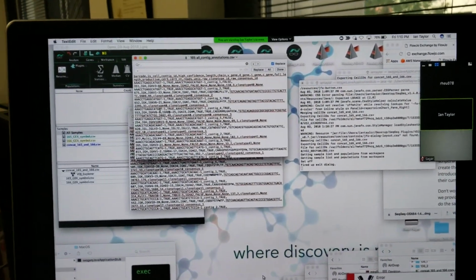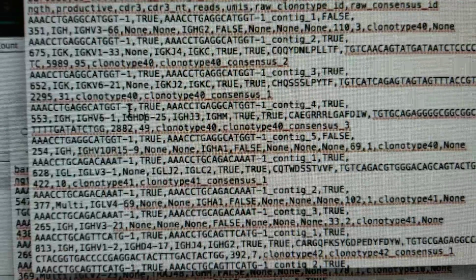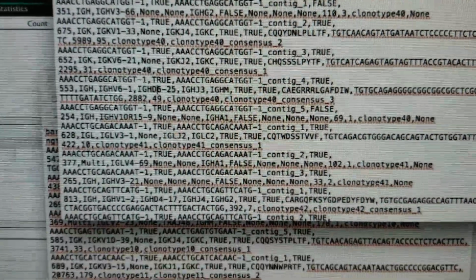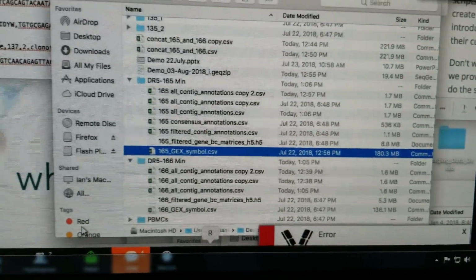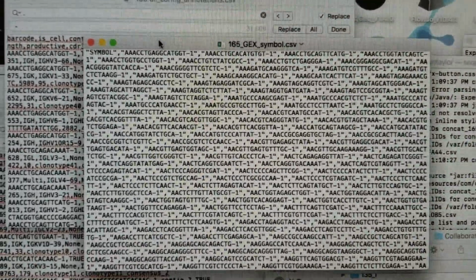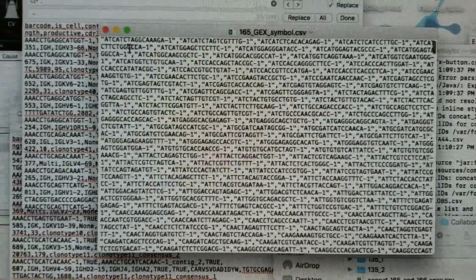We have barcodes which contain this oligo tag along with a -1. I'm not sure why that's added, probably by Cell Ranger, but that means to match the raw data. I can open up one of those gene expression files here, maybe 165, in something like a text editor. And we can see that indeed there are things that say -1 within the gene expression data.